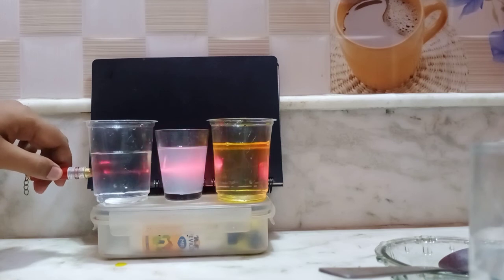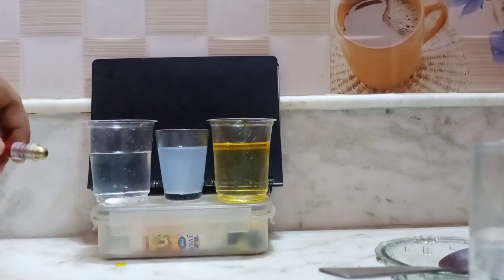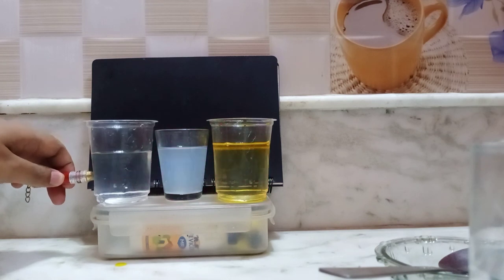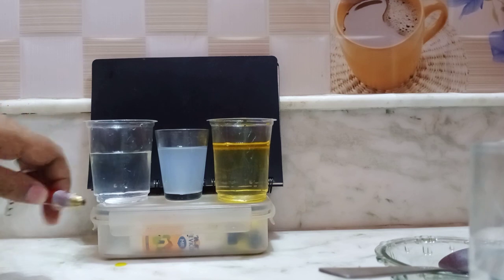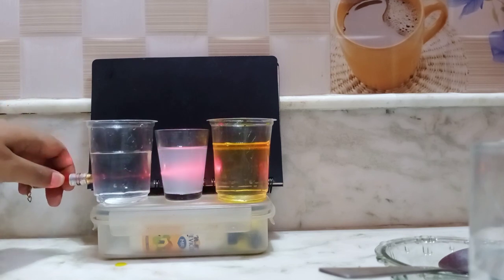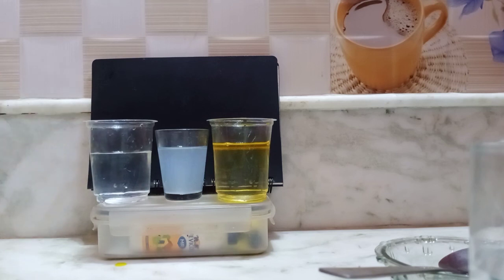You know that light always travels in a straight line, but it is clearly observed when it is passing through the colloidal solution. This is called a colloidal solution, and only the colloidal solution has a particle size that shows the Tyndall effect. In other cases also you may see a little bit of scattering of light, but it is not as clear. But in the case of the colloidal solution, it is very clear. Again I am showing, you can see this is a straight line that is passing, that is called the Tyndall effect.